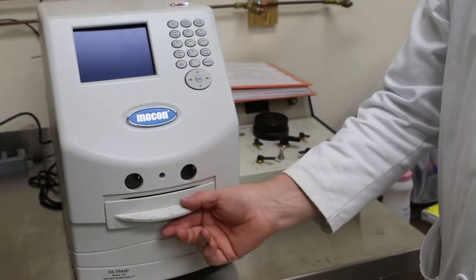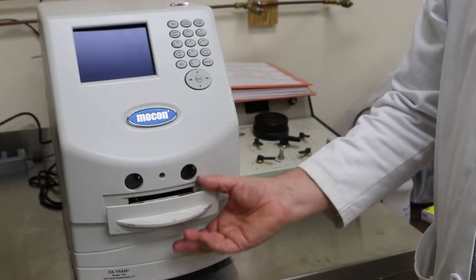My role is the lab manager. Part of that role is to help train students. We train them on common laboratory instruments, including pH meters, spectrophotometers, centrifuges, but we also have other specialized instruments.